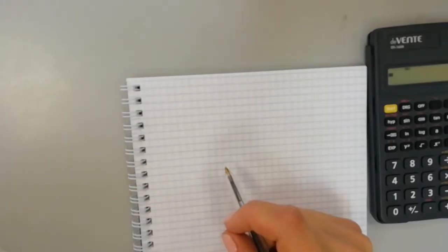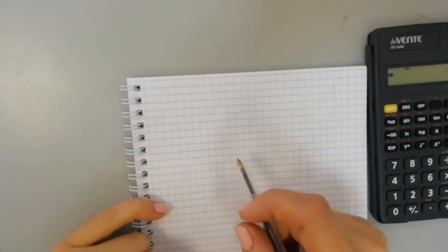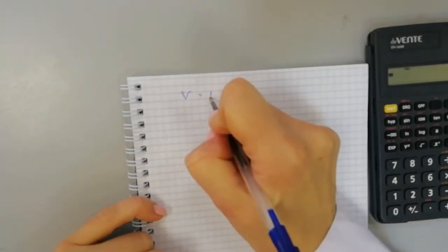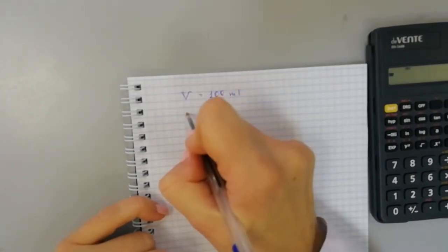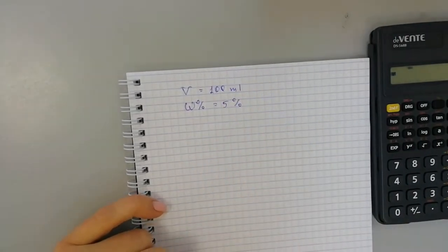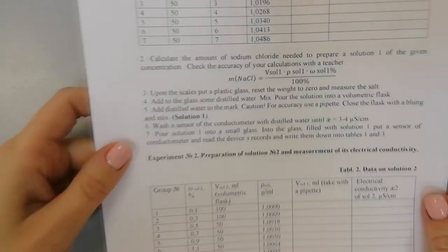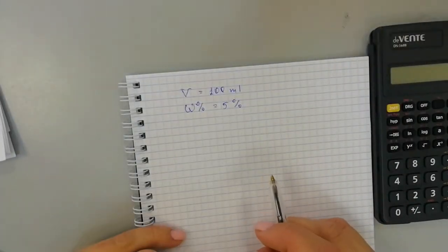First of all, let's do some preliminary calculations. We will prepare a solution with a volume equal to 100 milliliters and a mass fraction equal to five percent. We will use the formula which is given in the recommendations.